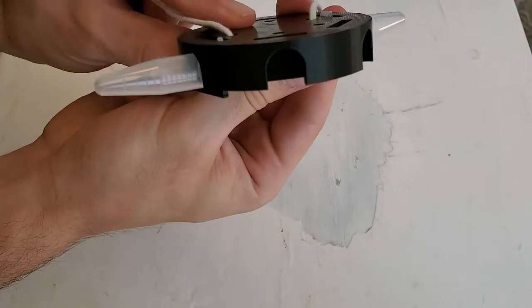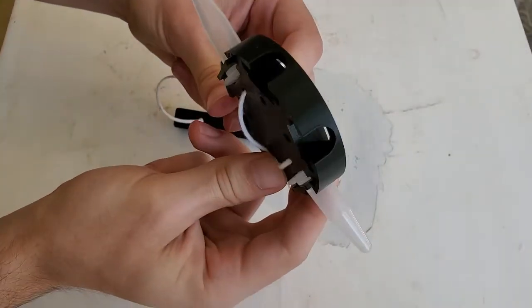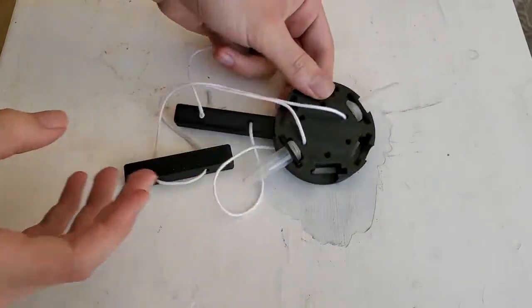After that, assembly is quite straightforward, and as you can see in the video, loading Eppendorf tubes is pretty simple as well.